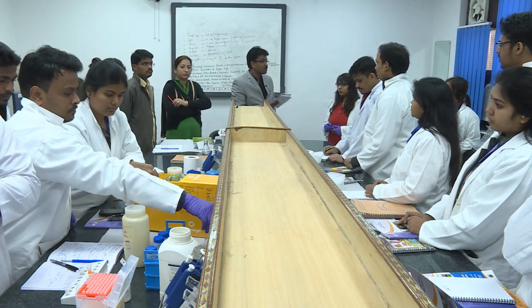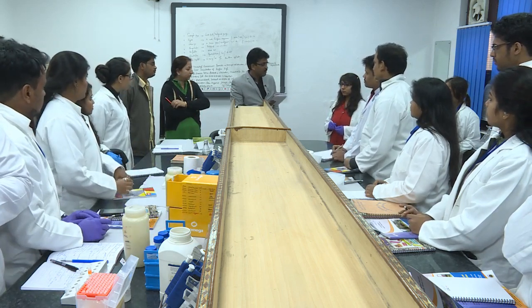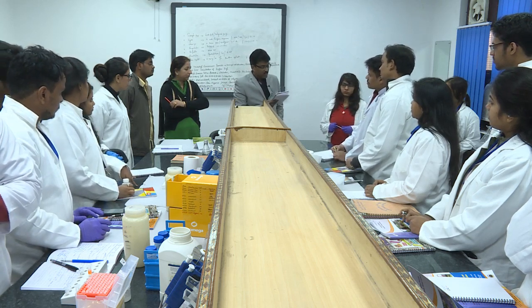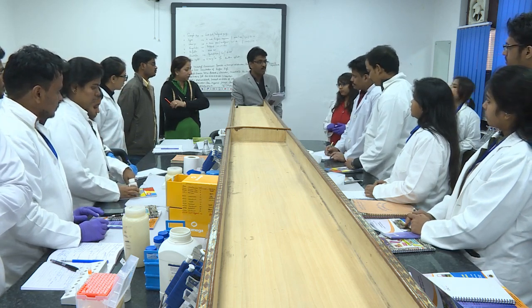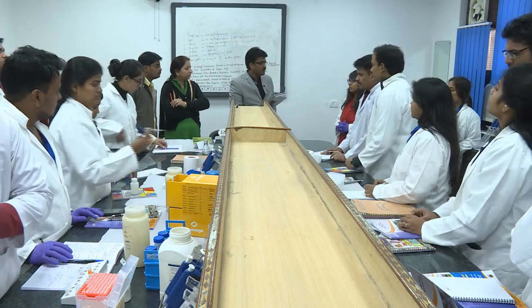So, you decide how much volume you want to make, right. So, let us go with around 50 microliter. You just calculate for 50 microliter of 100 nanograms per microliter how much you need to take from the stock. So, you simply use a small formula, V1 N1 equal to V2 N2.